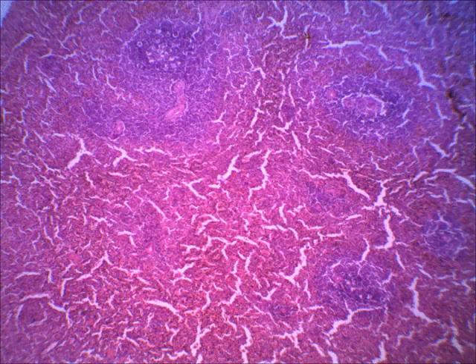Okay, the next couple of slides would be of a spleen. Now, at first glance, the spleen does look quite a bit like the lymph node, but the spleen has two major tissues in it. That's real easy. They're called red pulp and white pulp. Obviously, the red pulp is where there's going to be a lot of red blood cells. The white pulp will be where there's a lot of white blood cells.